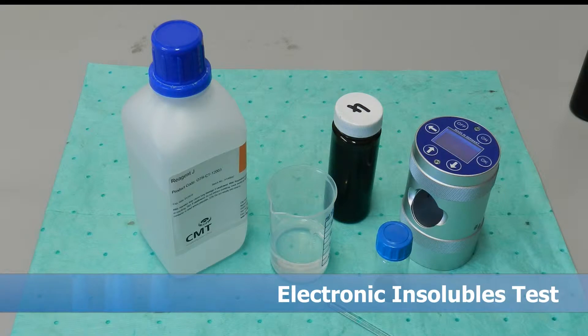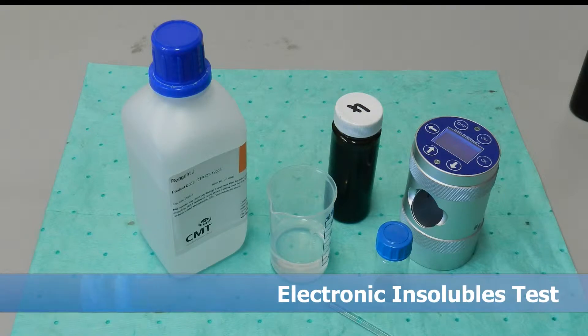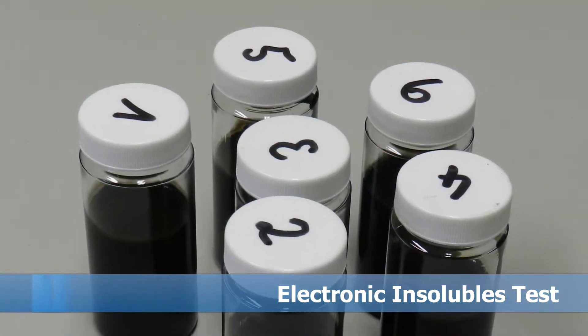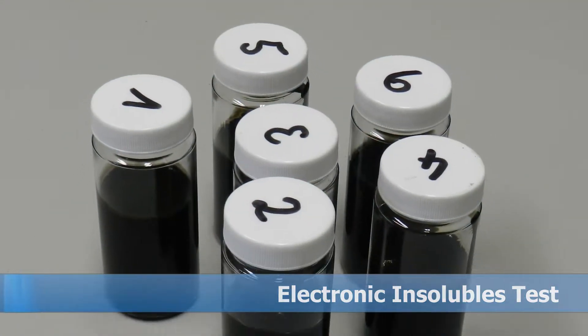The test will give you the soot loading of your oil sample in percent.